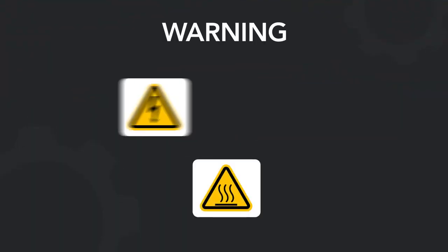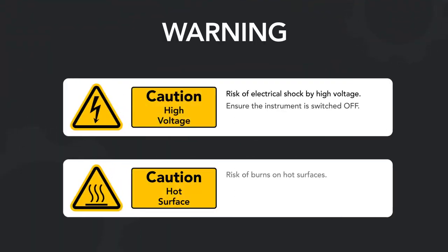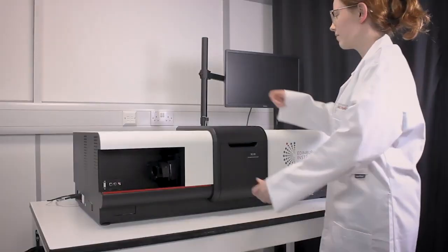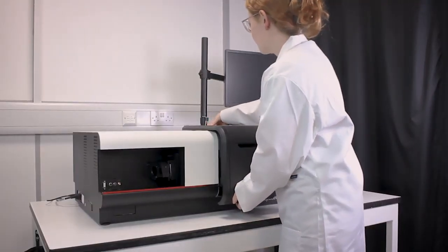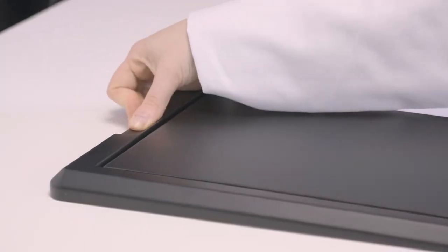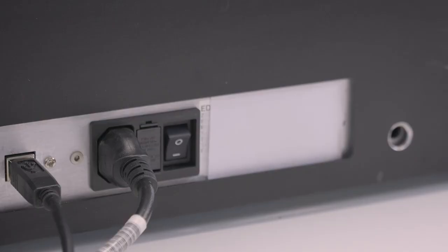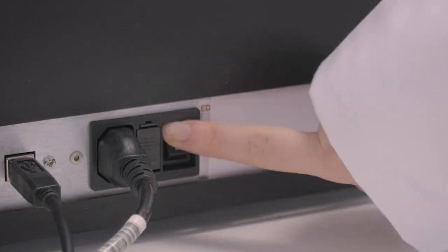This video will show you how to uncover the FS5 spectrofluorimeter for service access. First, remove the sample cassette by pressing the button and pulling. Make sure that the instrument is switched off before continuing.